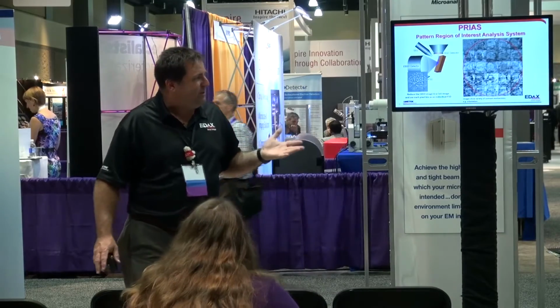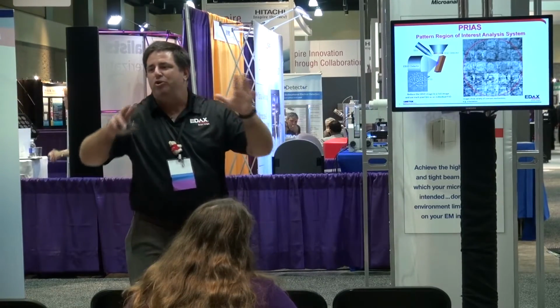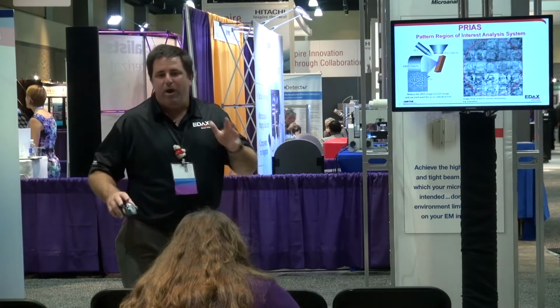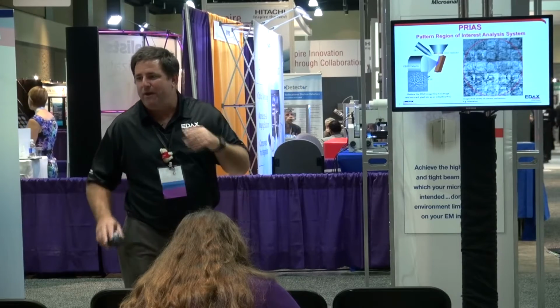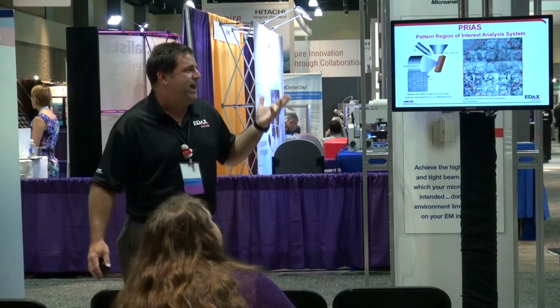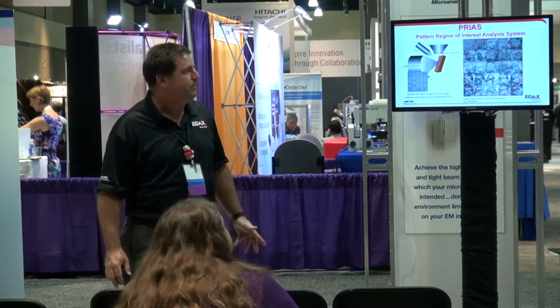That's great, kind of like what we see with a forward scatter detector. But when we have all these, we're able to track multiple changes, so that between this whole set of images, we're able to see optimal contrast basically throughout the microstructure and see when things change. And of course, the idea is that contrast and change is information when we're talking about imaging.